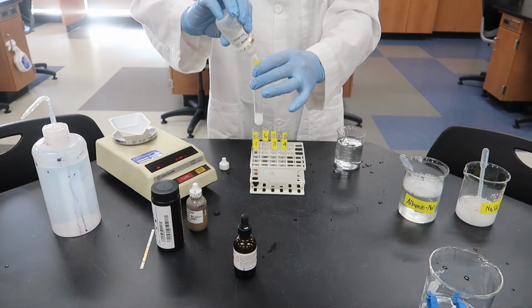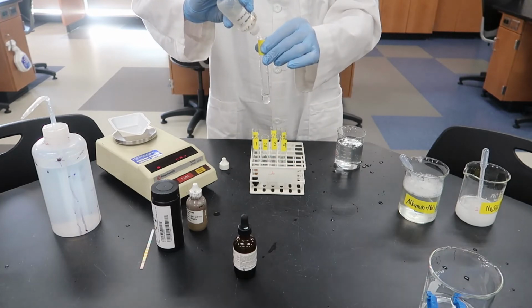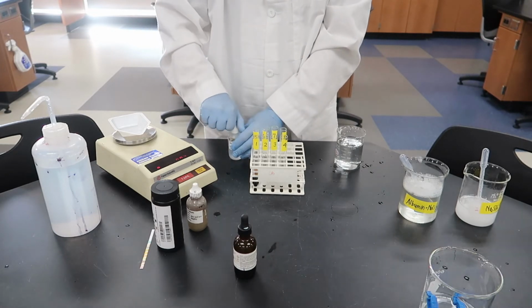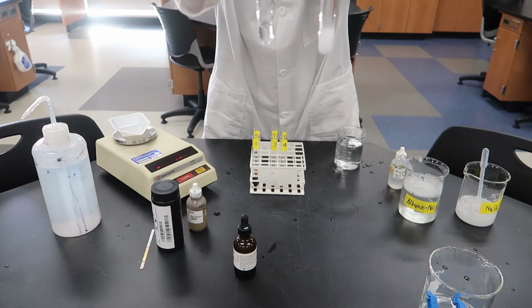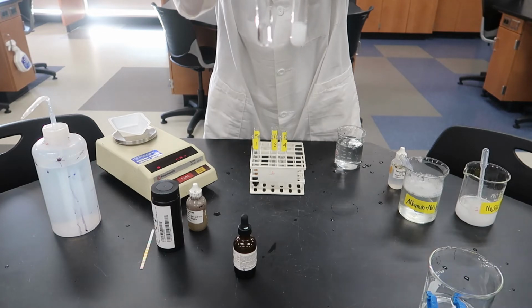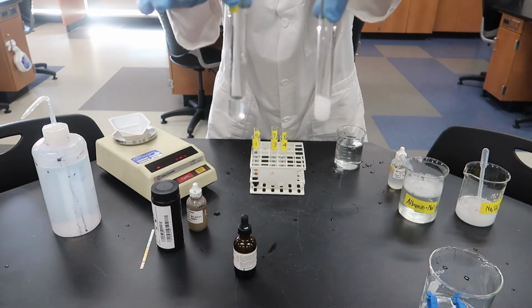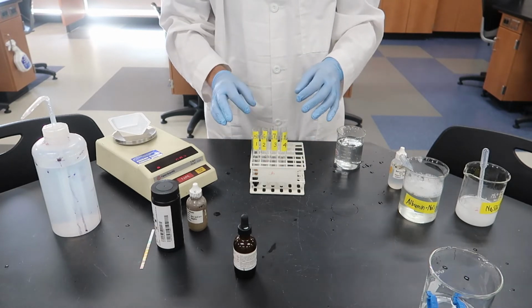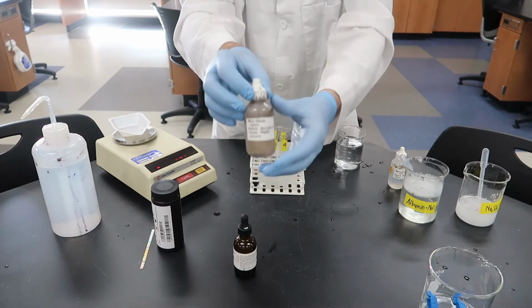And this one's a little bit trickier to use because the starch solution is already cloudy. What we're looking for is a white precipitate to form. If you remember what barium chloride tests for, it tests for sulfate. If we mix these together, it's kind of hard to tell, but test tube number 2 became a little bit whiter, a little bit more opaque. It's hard to see in the video, but it did become more opaque. There was a white precipitate.